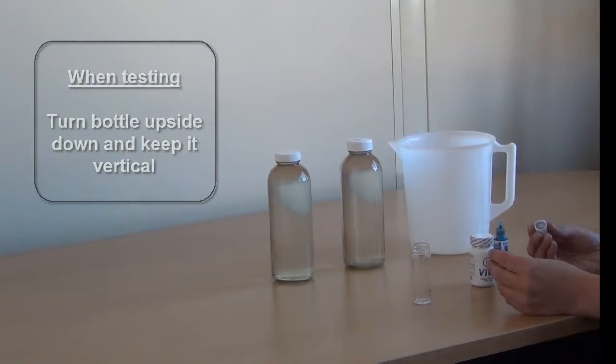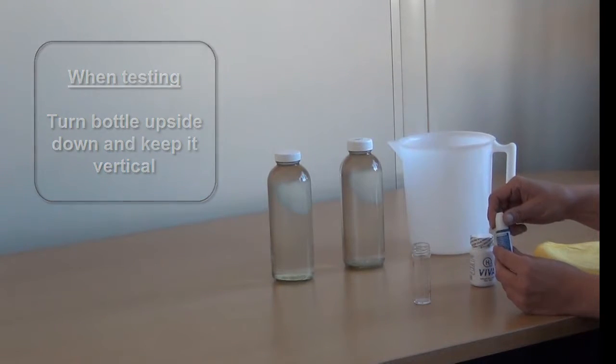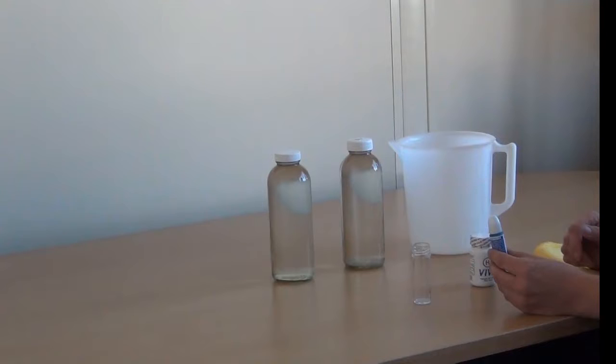When testing it's important to turn the bottle completely upside down. Squeeze it so one drop exits and then release the pressure.